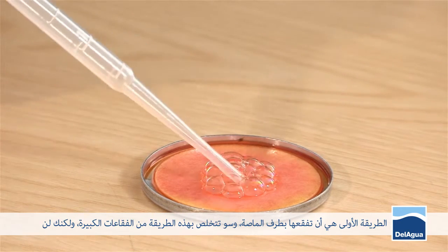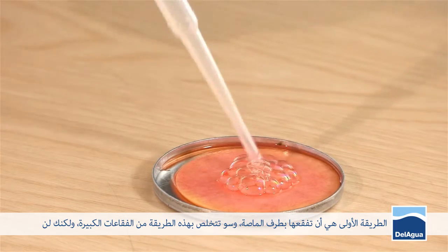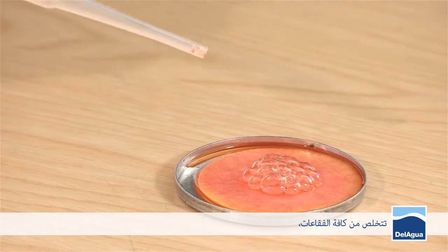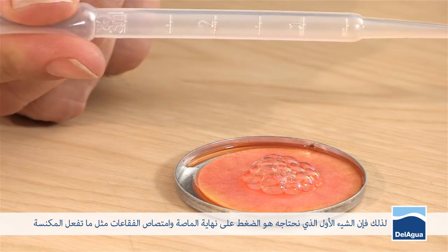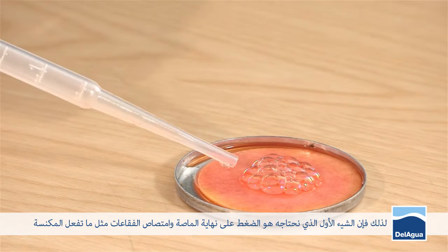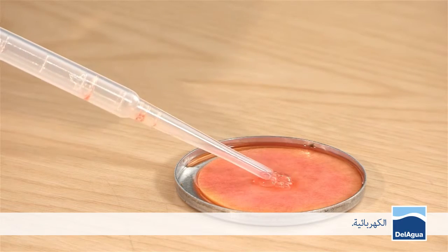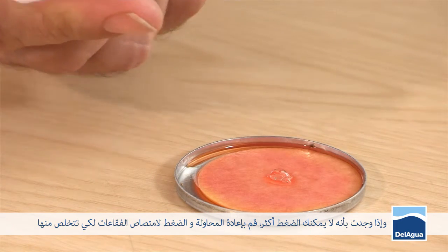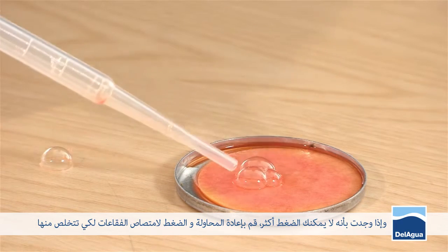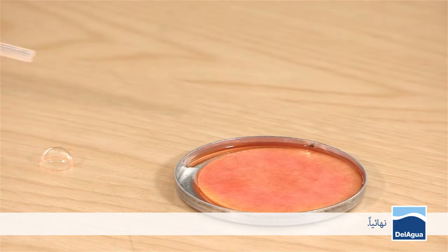If you do end up with bubbles, there are two ways to get rid of them. The first is to stab them with the end of your pipette — that will get rid of the very large bubbles. But you'll notice it doesn't get rid of very many, so the better method is to squeeze the end of your pipette and suck the bubbles out, much like a vacuum cleaner. If you run out of squeeze, squeeze again and suck them out until you're bubble free.